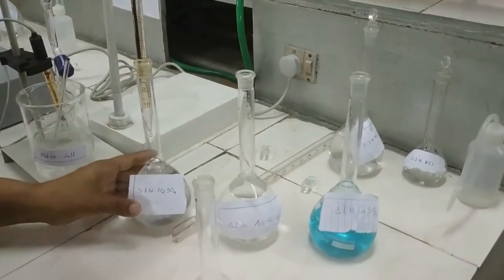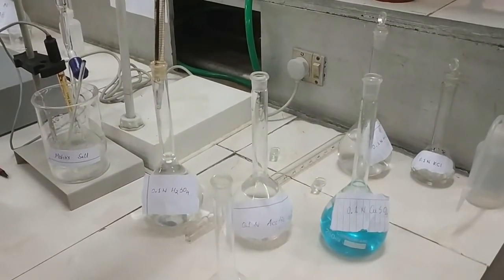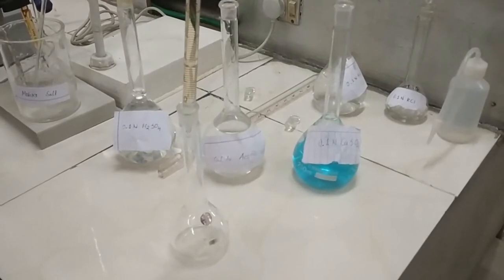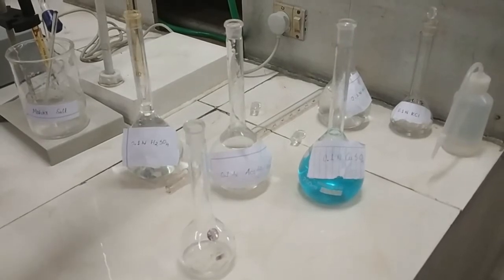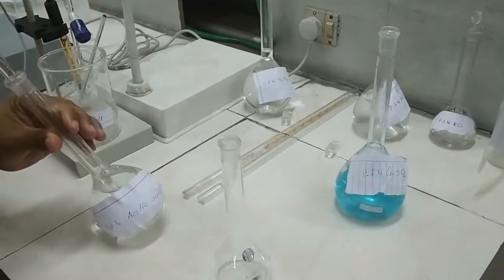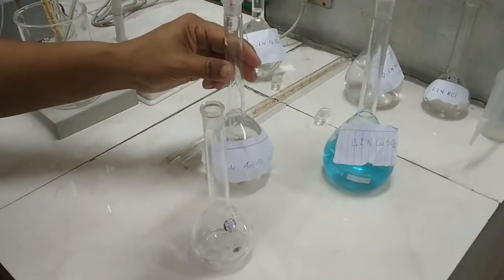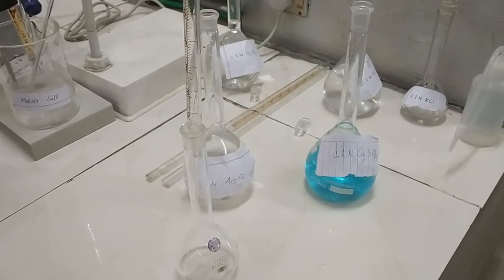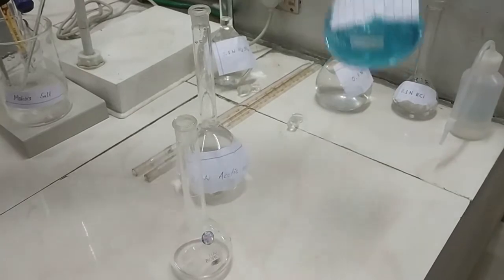Here it is 5 ml of 0.1 normal sulfuric acid, which is prepared from concentrated sulfuric acid by the volume by volume method. Then we have to take 5 ml of 0.1 normal acetic acid. And we have to take 5 ml of 0.1 normal copper sulfate solution.